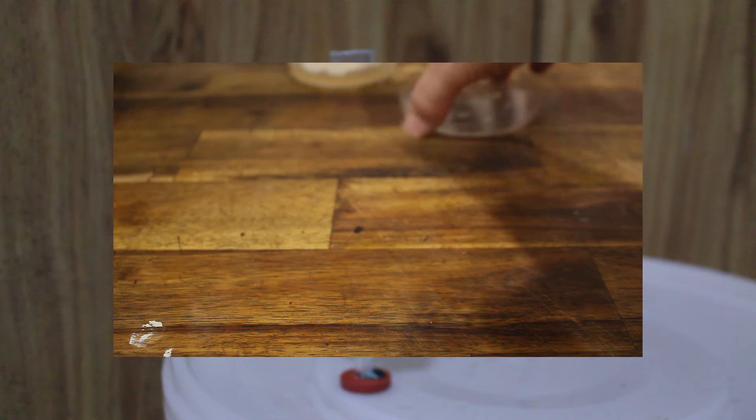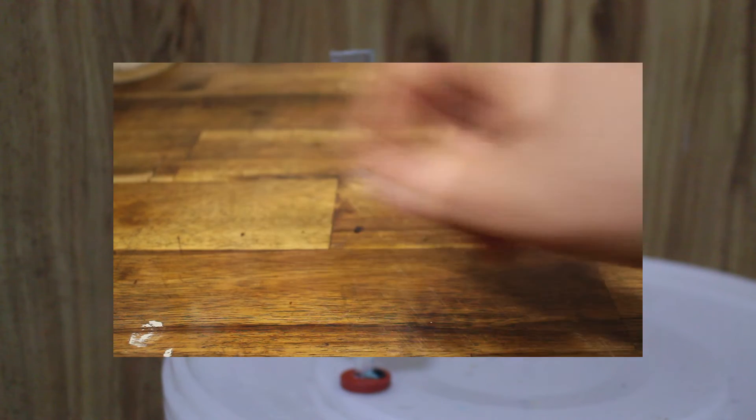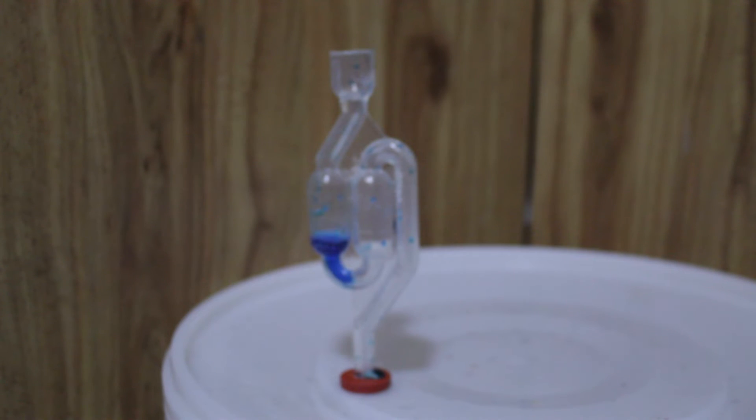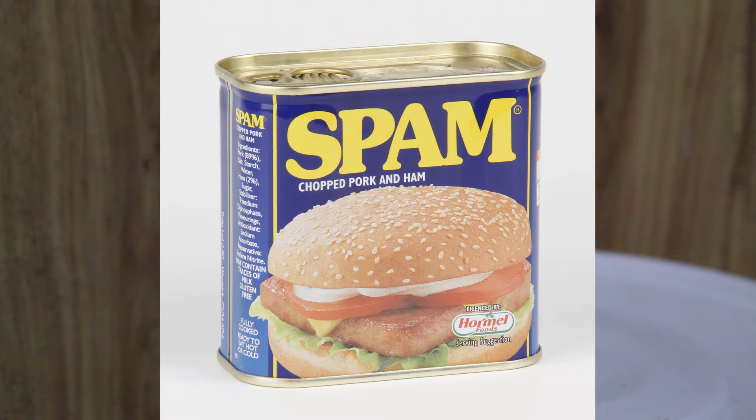If you leave this or any other petri dish open or cultured for too long, you start to grow mystery things. It's like how leaving food out for a short time is okay and it is still good for you, but if you leave it out for too long you get something nasty growing and you definitely don't want to be eating it.